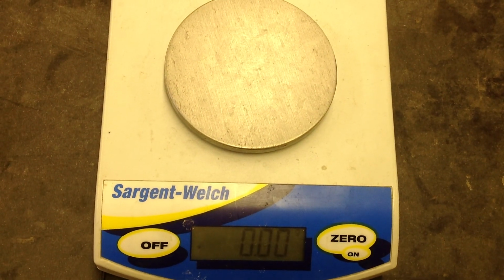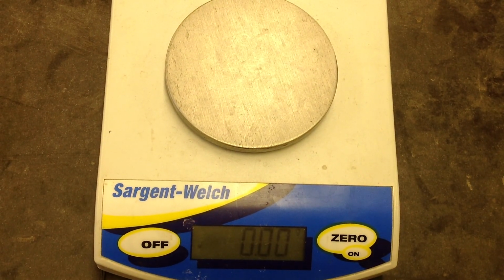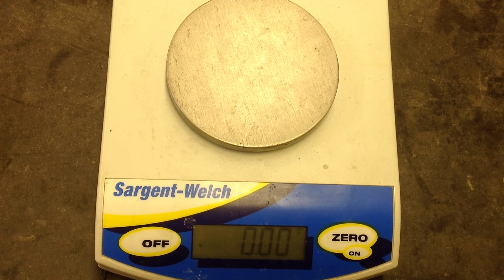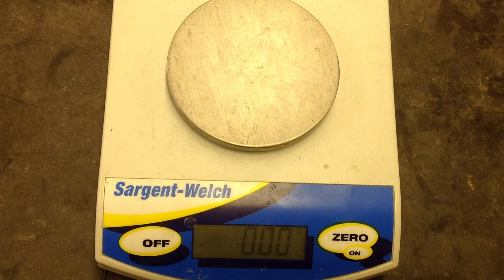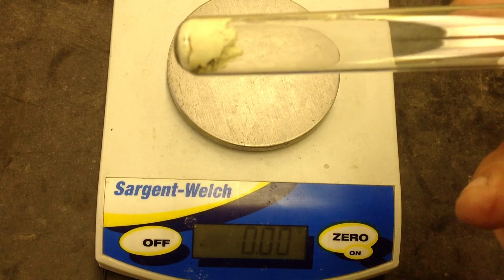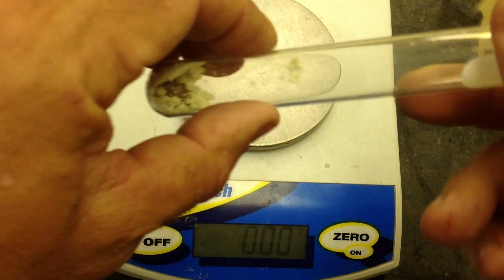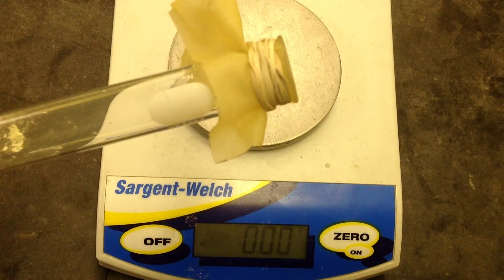Okay, today we're going to be performing an experiment called the mass of copper and sulfur experiment number 2.5, and our problem in this lab is, does the mass change when copper and sulfur are heated? We're going to start out with copper and sulfur in a test tube, and there's both copper and sulfur in there, and this test tube is going to be sealed with a rubber sheet and a rubber band.